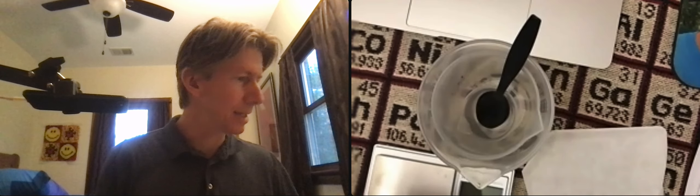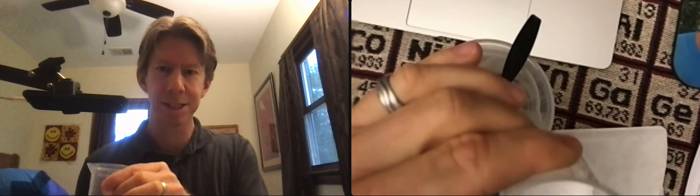I've got my table salt. For me I went and got salt from my kitchen and I put it into a separate beaker so it's ready.